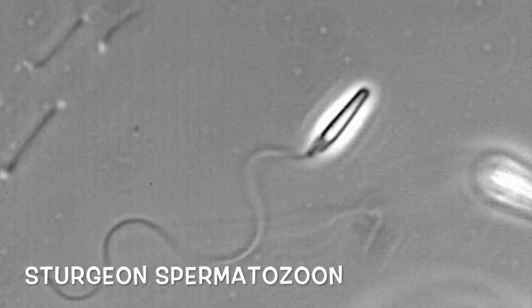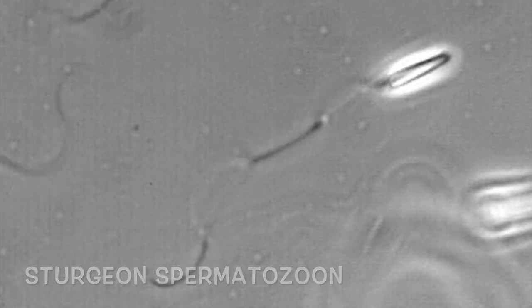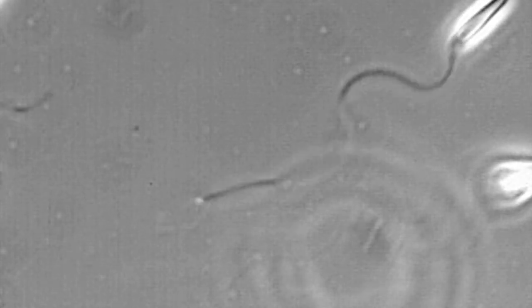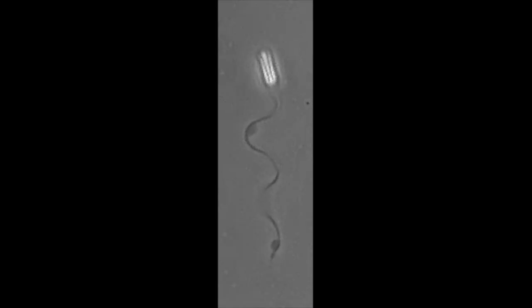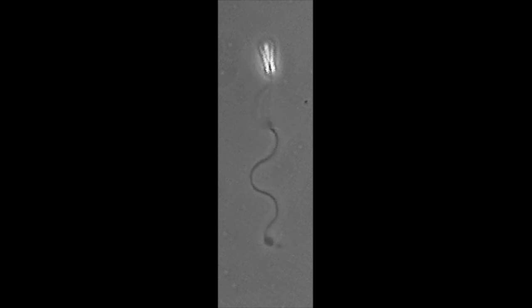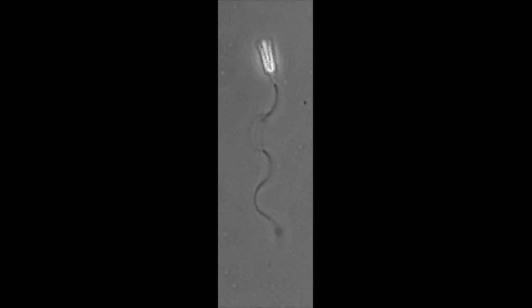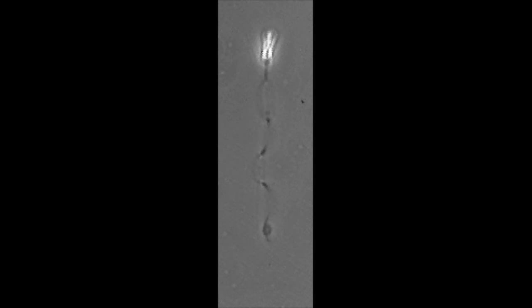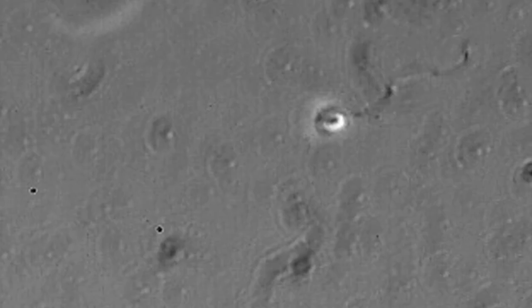This is a sturgeon spermatozoa at high magnification. Again we can see that after a few minutes post activation, the long flagellum has some blebs which result from osmotic shock.